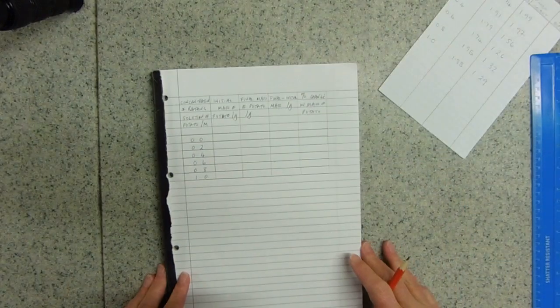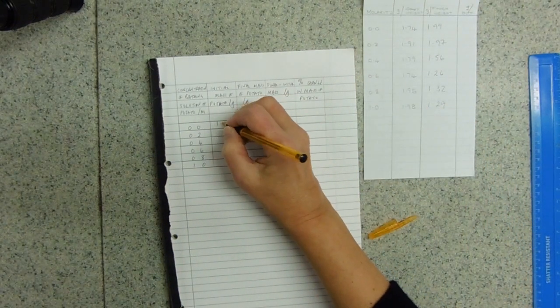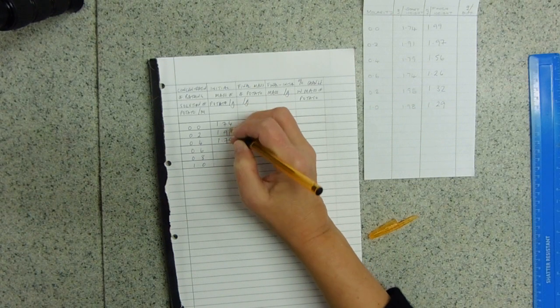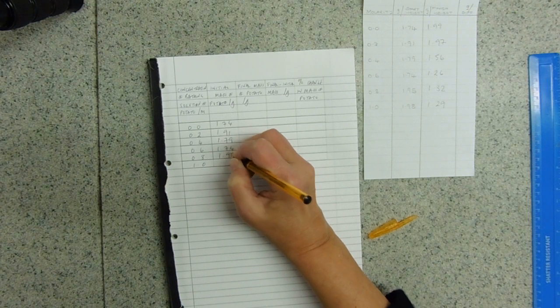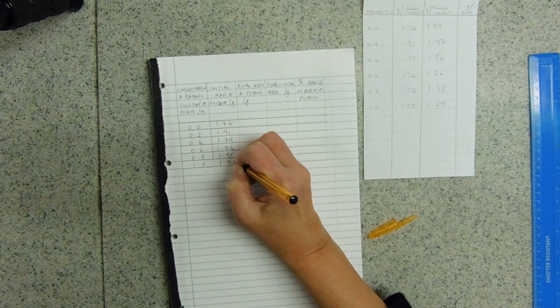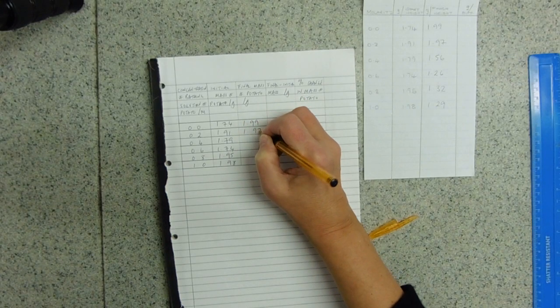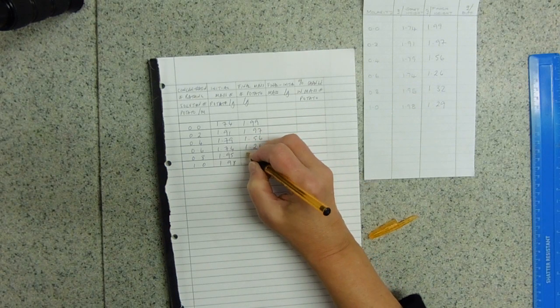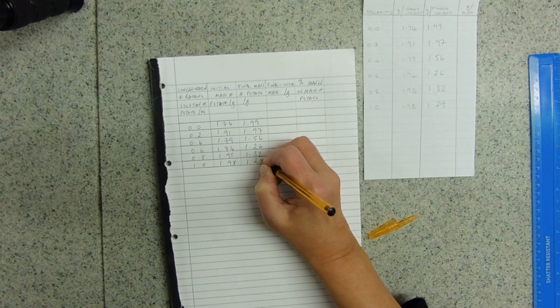Okay, I'm just going to check that we're all good. Starting masses: 1.74, 1.91, 1.79, 1.74, 1.95, 1.98. Final masses: 1.99, 1.97, 1.56, 1.26, 1.32, 1.29. Excellent.